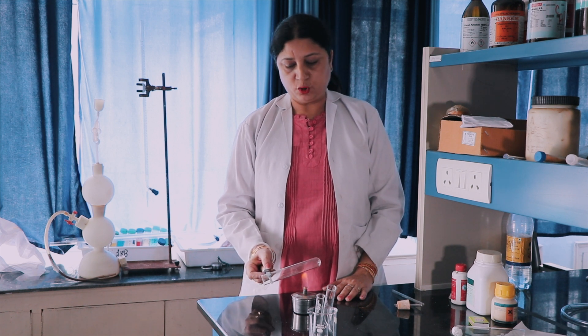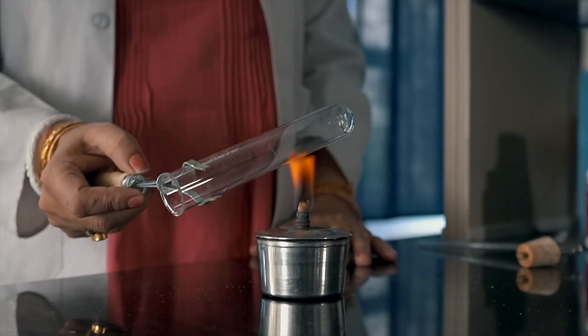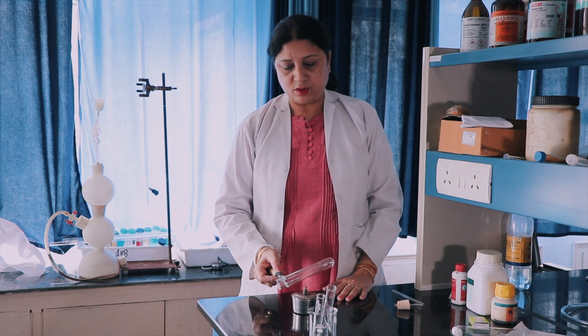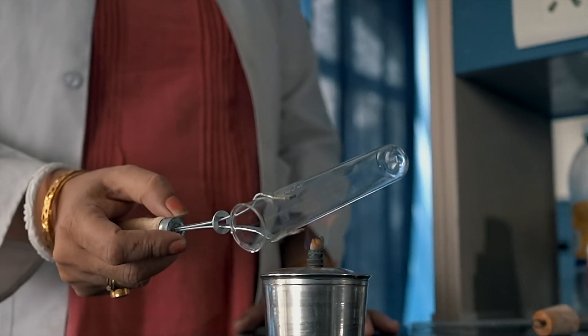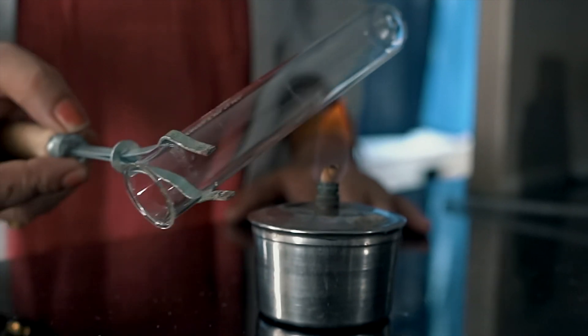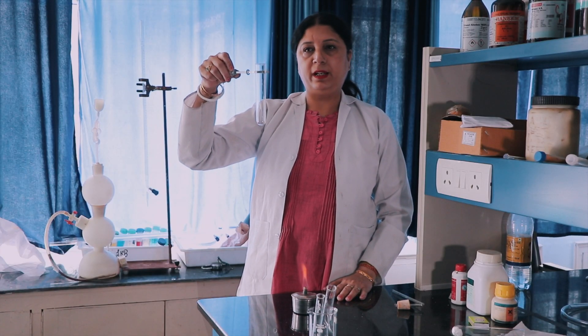Dear students, I will explain how to dry a glass test tube. First of all, heat this way and slightly rotate it so that if there is any moisture inside the test tube, the water droplets should come out. This way the test tube is dry. Now you see my test tube is absolutely dry.